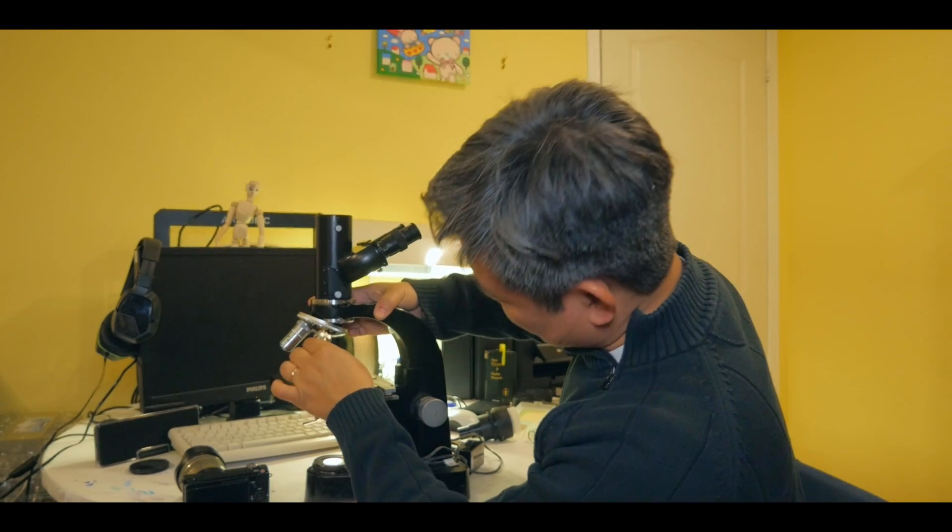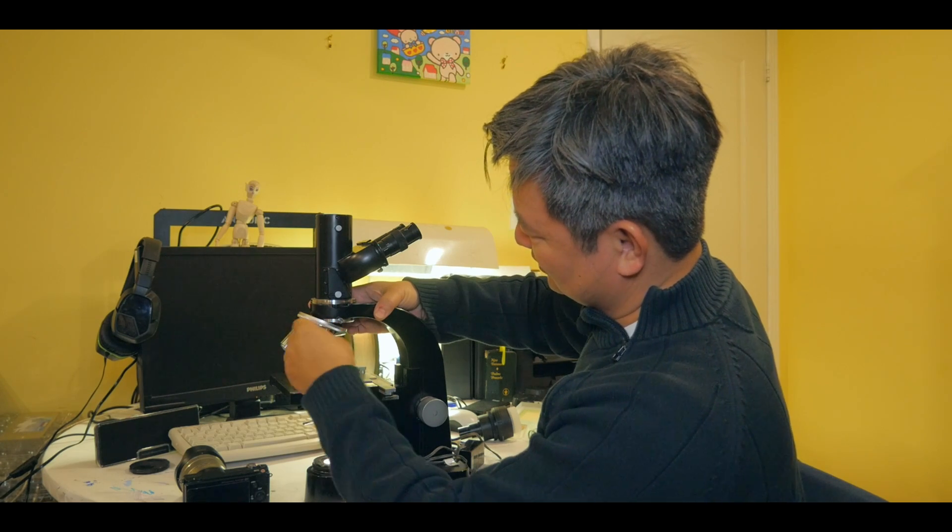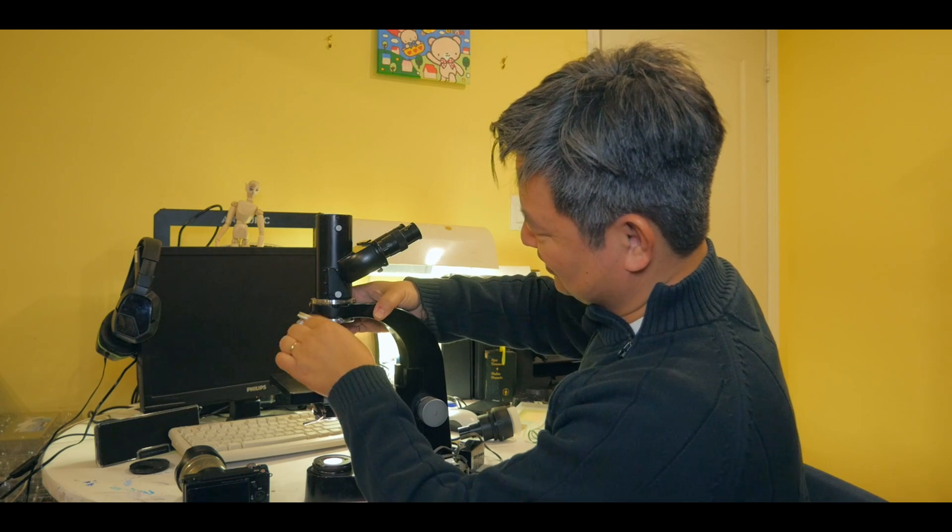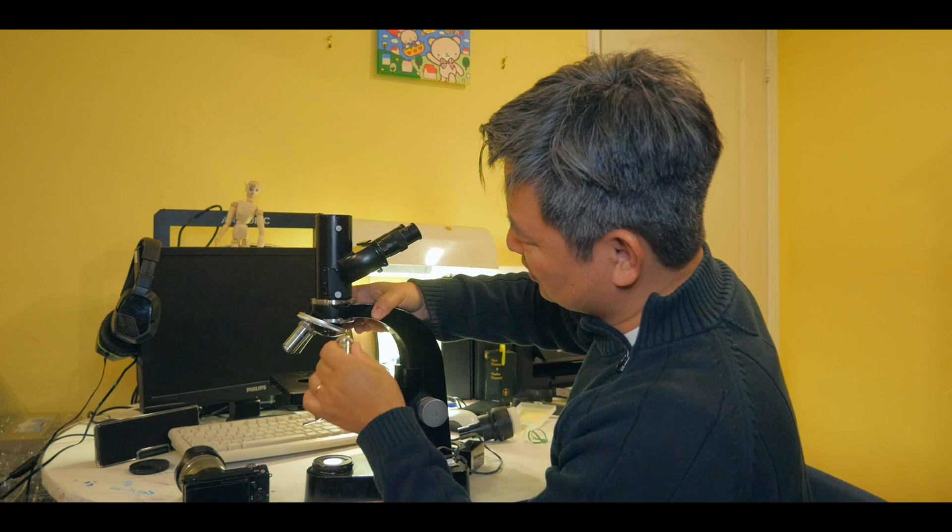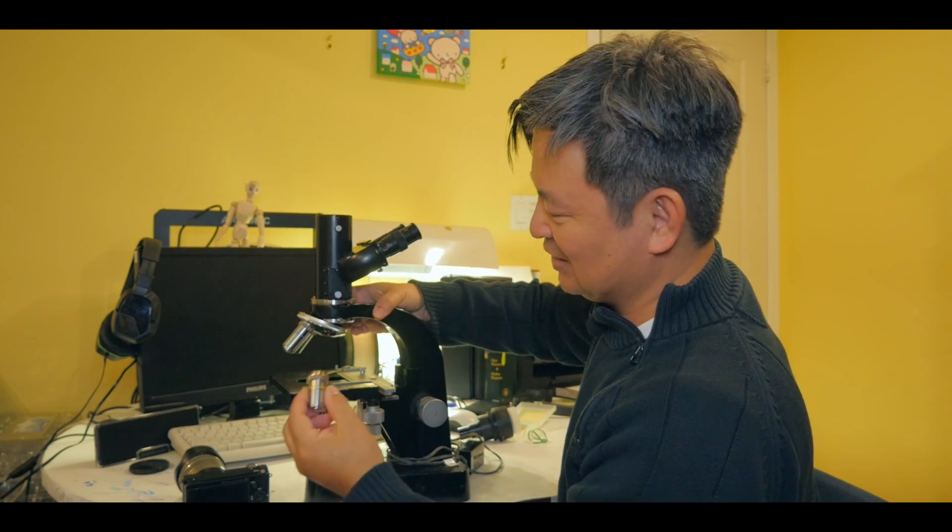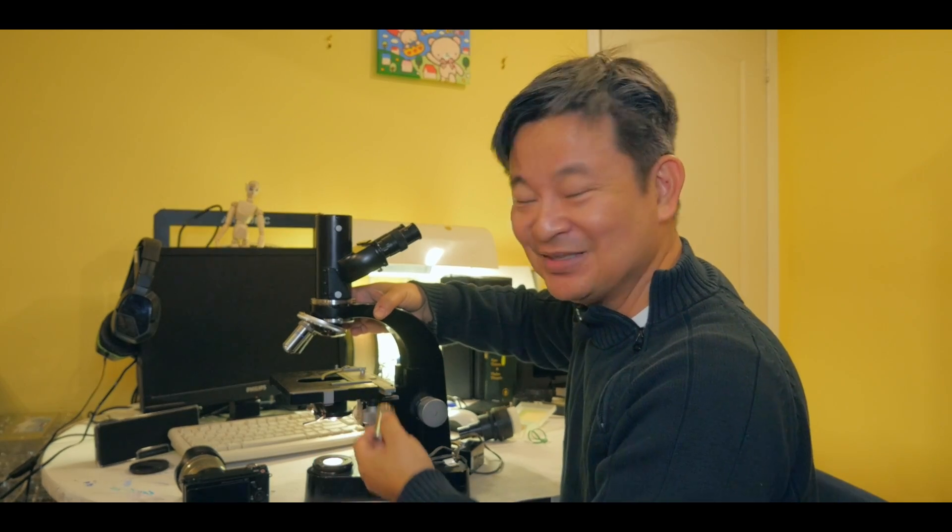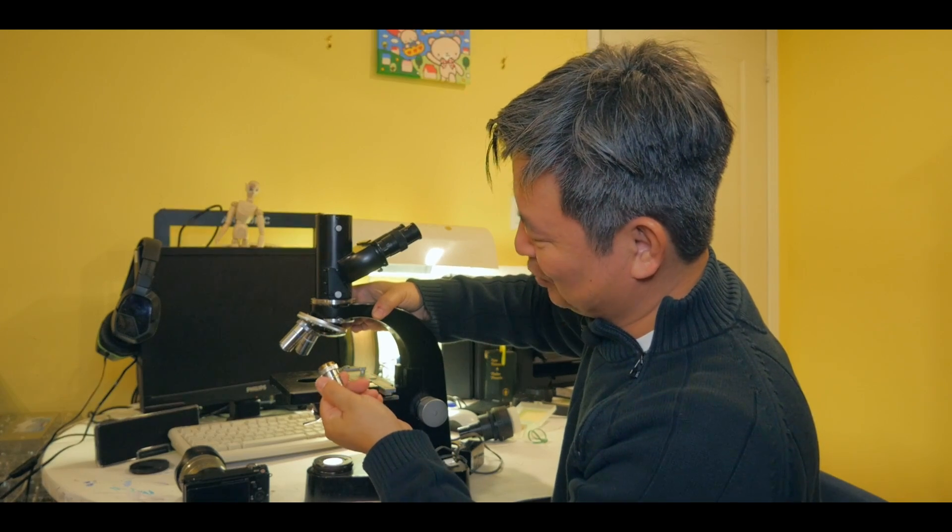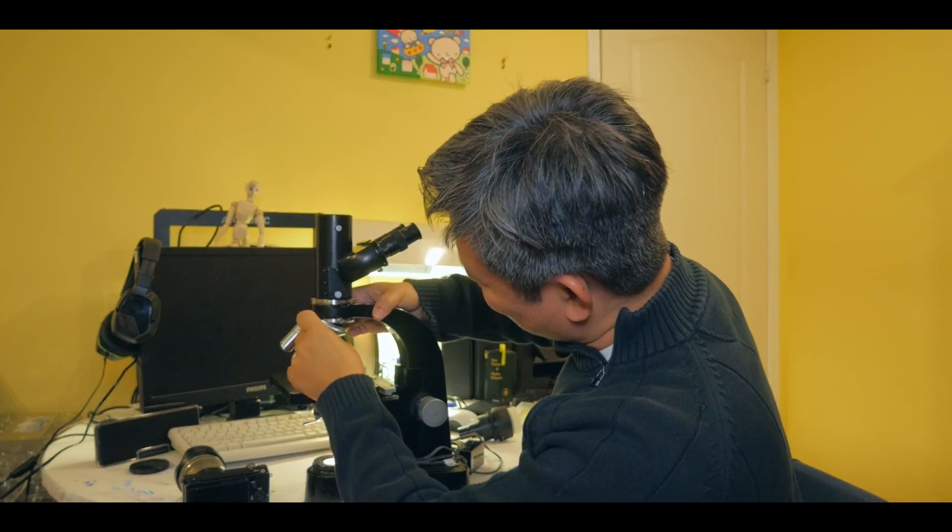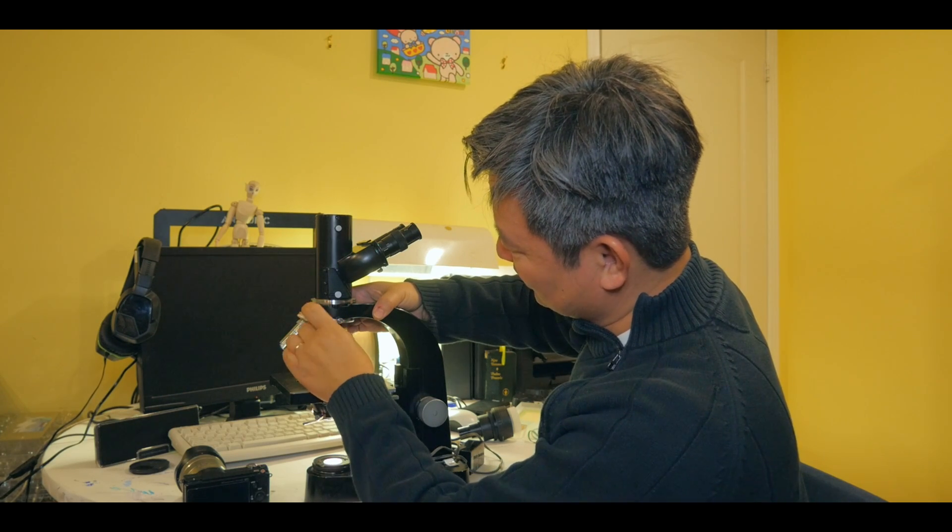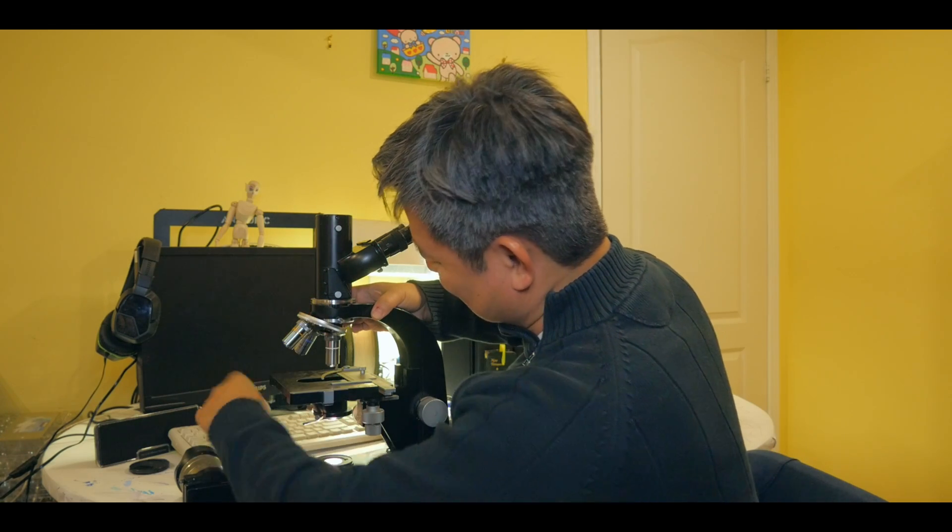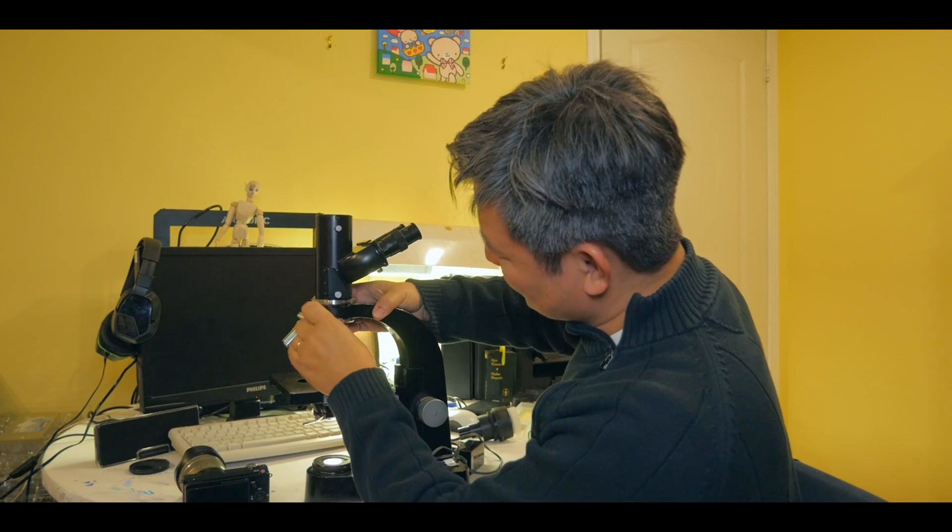So here we have a 40 times. Okay, let's put that in. Again, fits perfectly in there. I wish I could get Leica objective lens, but they're just too expensive. I can't afford it. You know, this microscope I bought for less than a hundred bucks and then to get an objective lens, that's like, you know, eight times, you know, the whole set, eight times what it costs. It's going to be, you know, breaking the bank there for me. Okay. So, no, maybe someday I will be able to acquire it, but just knowing the fact that I could just use any objective lens and put it in there and it still works well. That's, that's good to know, right? Okay. And last one we're going to put in is the four times. Okay. So the objective lens now fixed, the light is now fixed.